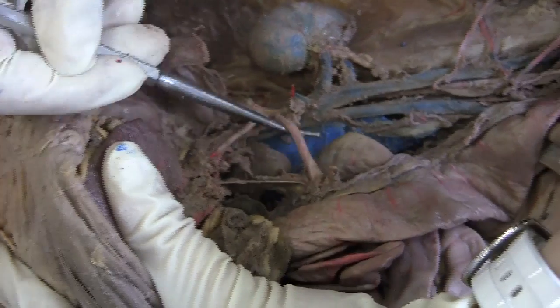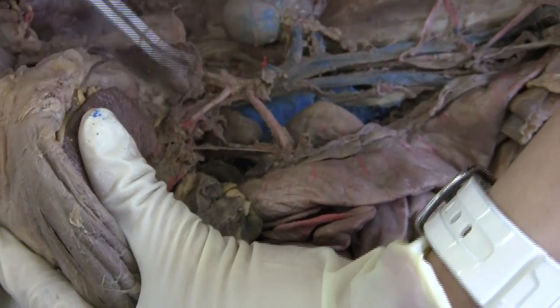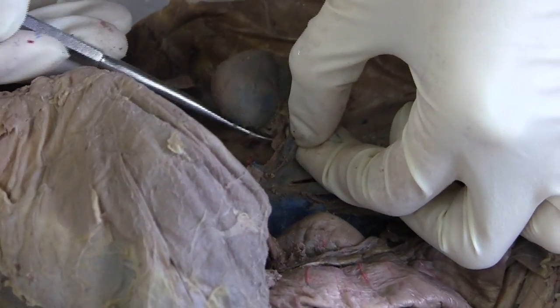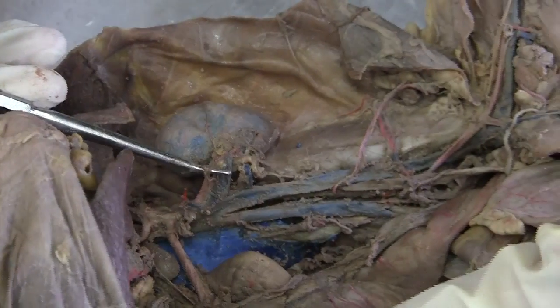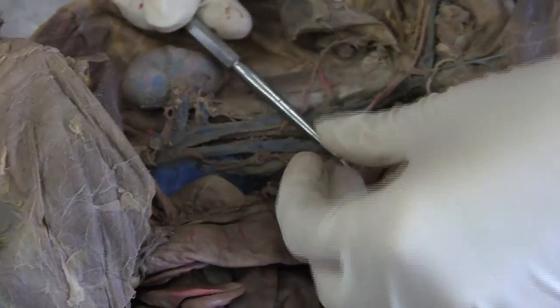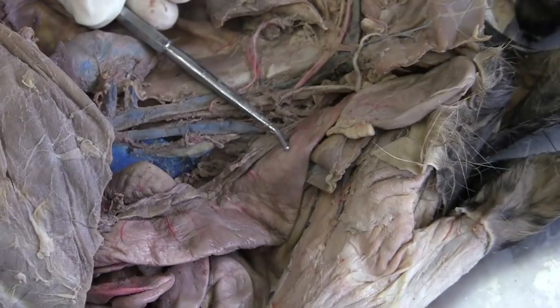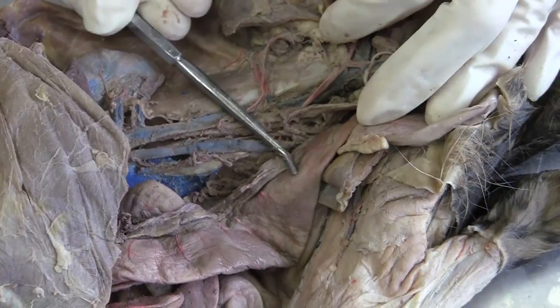Superior mesenteric artery here. And the renal artery — just right here, this one, the renal artery, the red one. The inferior mesenteric artery is right here, but maybe we just cut through it. It's just like the superior but it's underneath. The inferior mesenteric artery is right here — yeah, it's connected to the large intestine.